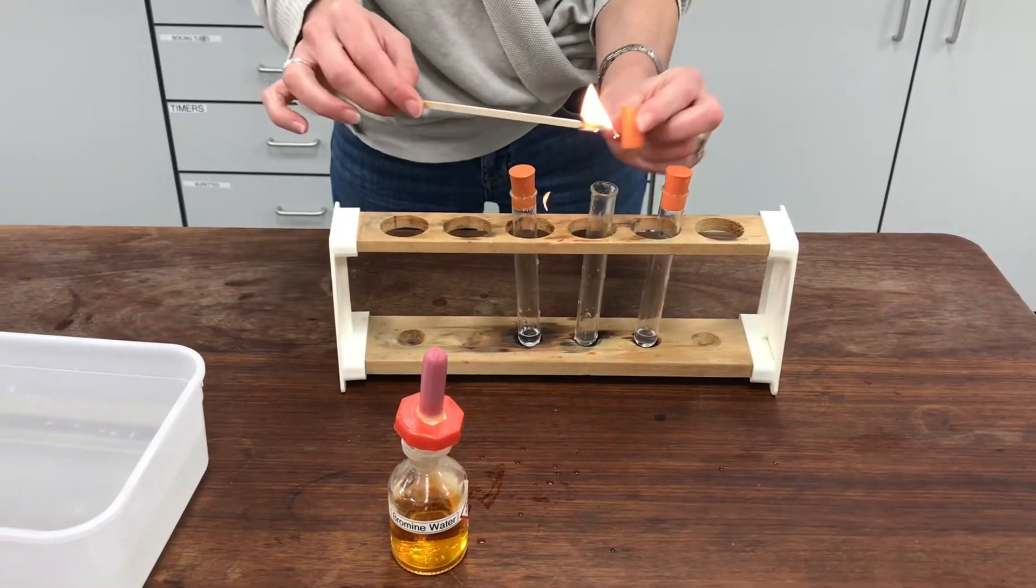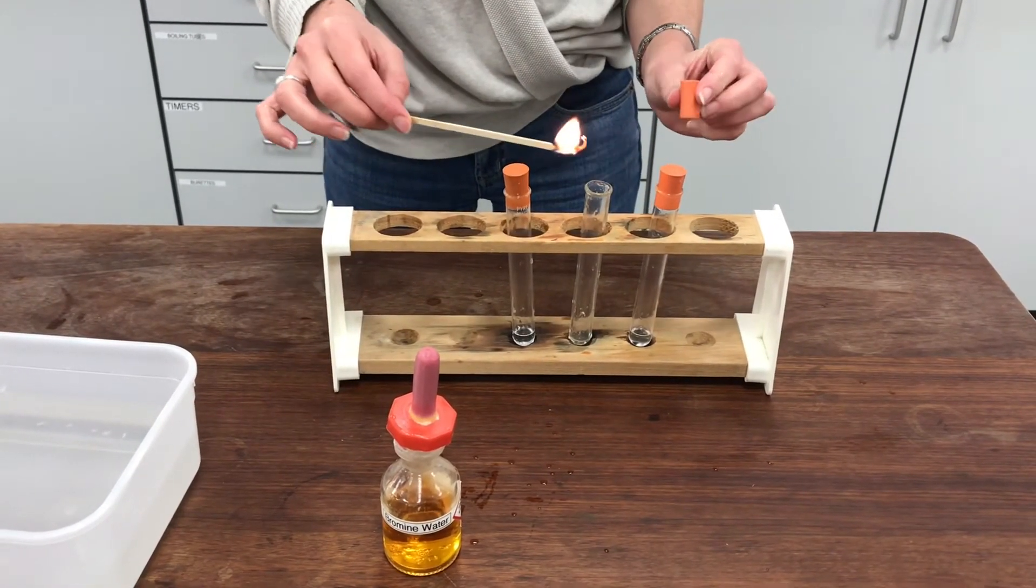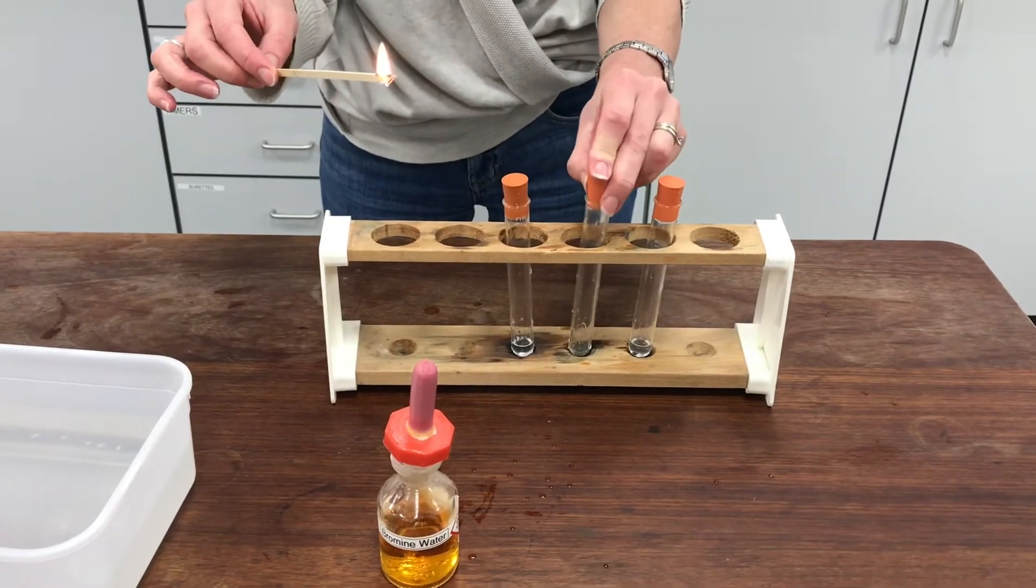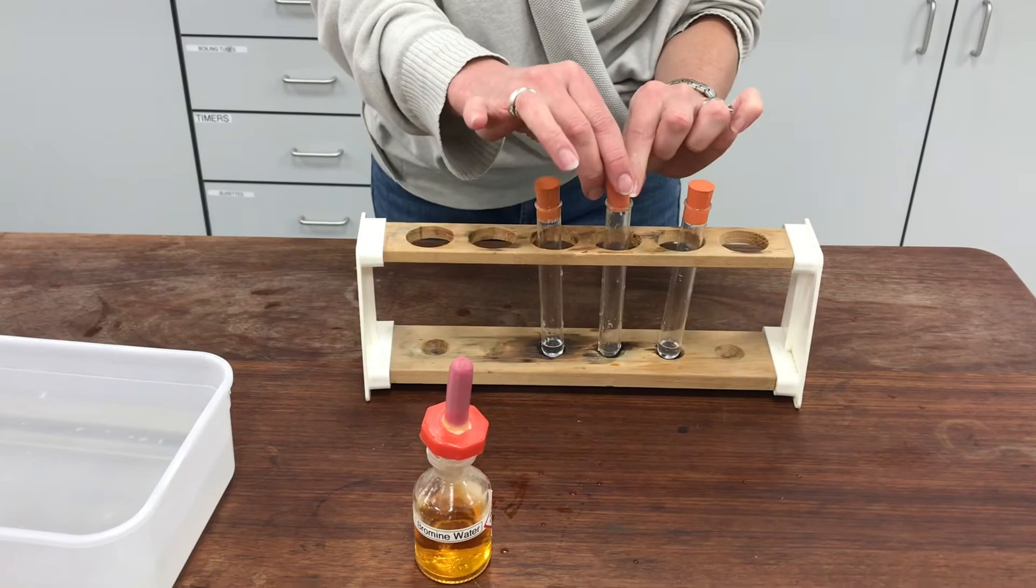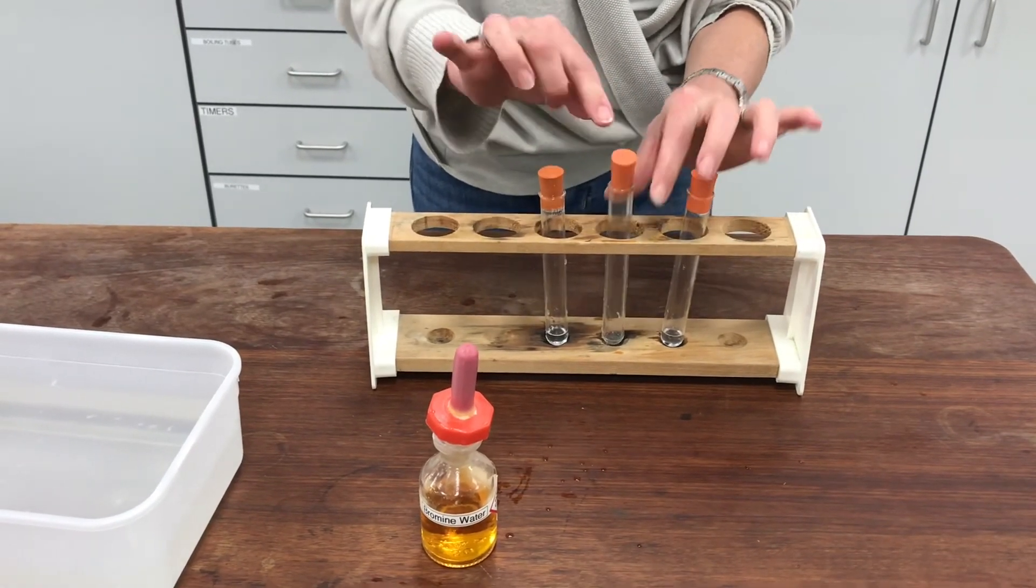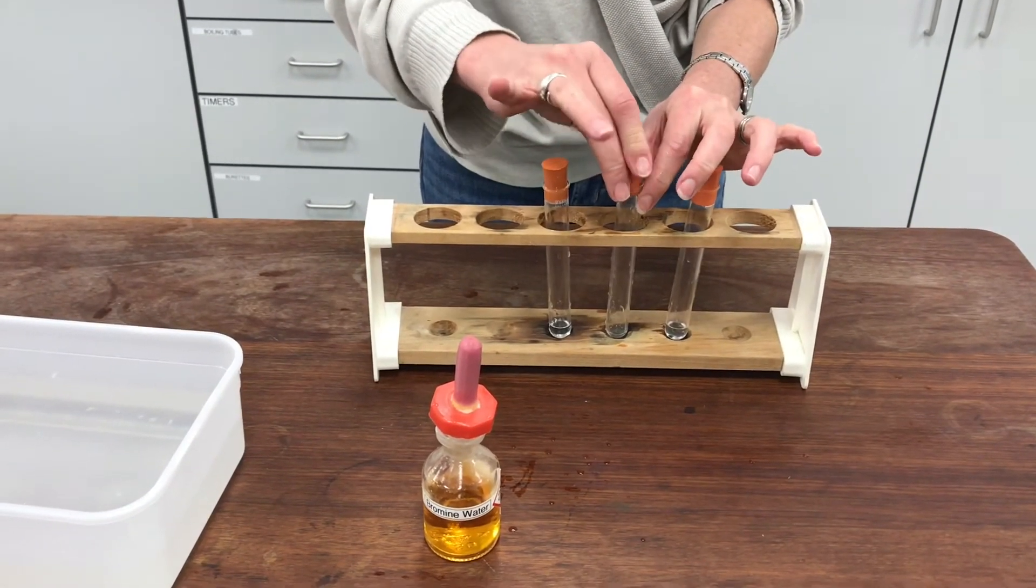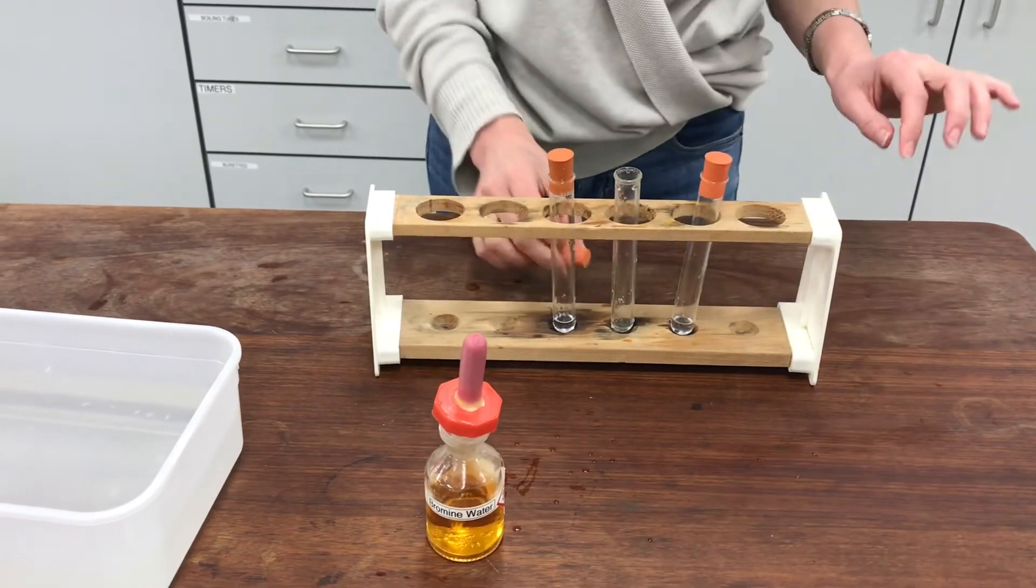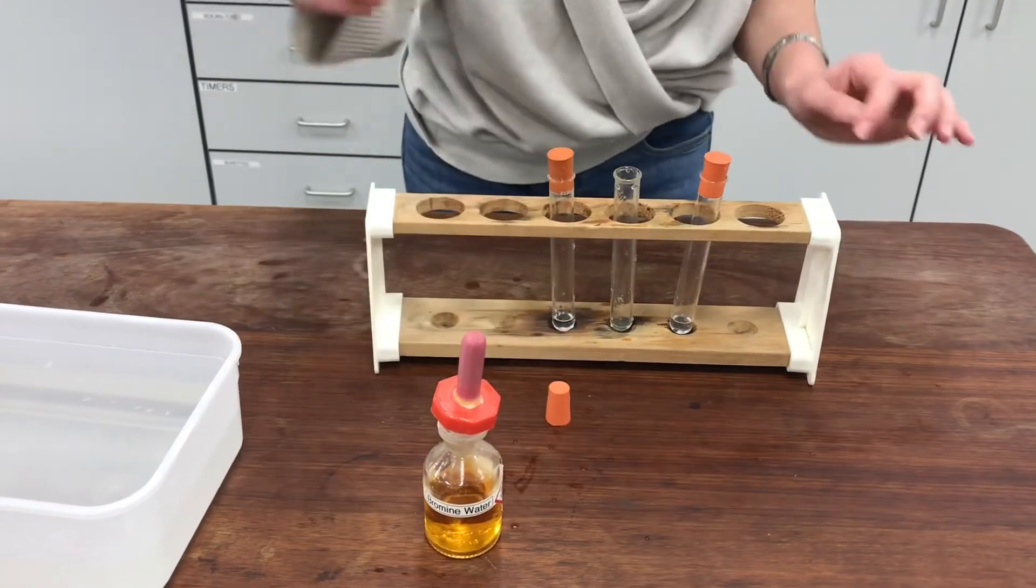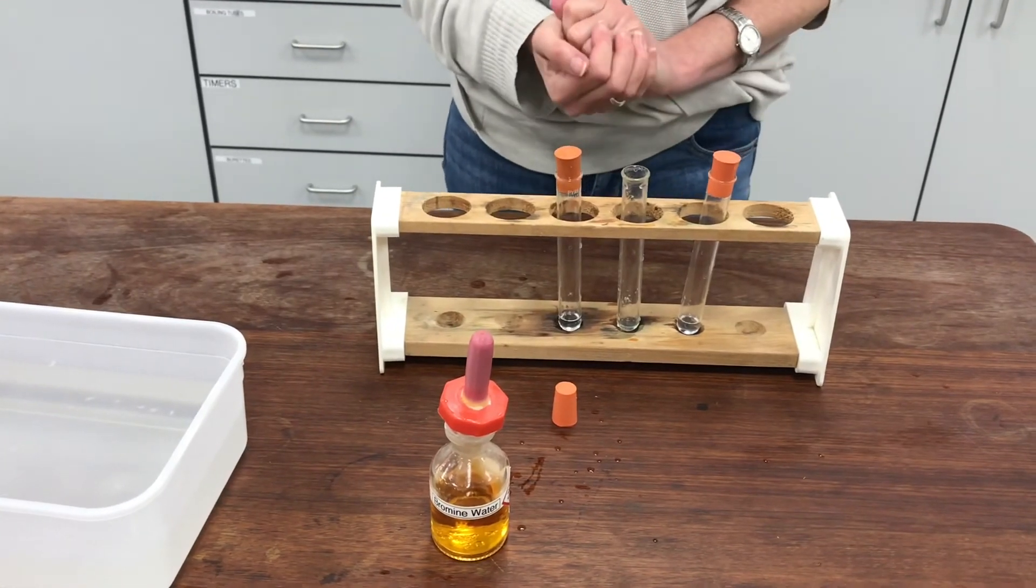OK, so if I bring my splint there. I don't know if you saw that. There was a tiny little burst of flame. And a teeny little flame emerged very slightly from the top of the tube. So I hope that's convincing proof that the gas that I've made is also flammable.